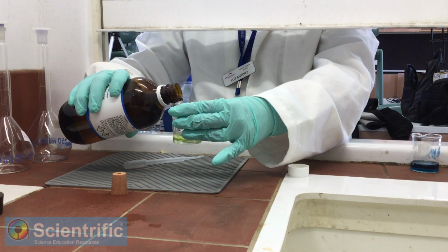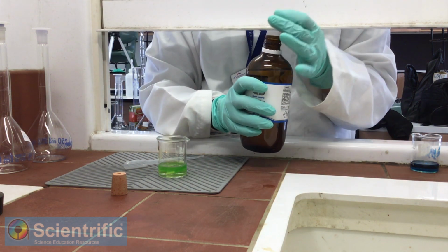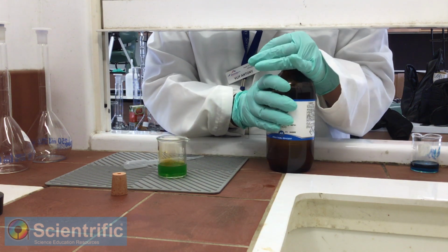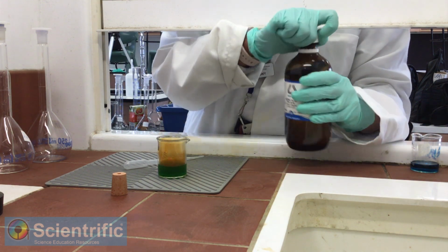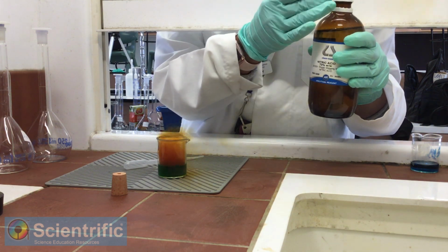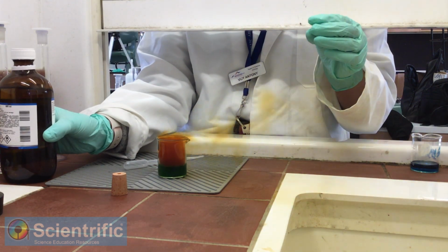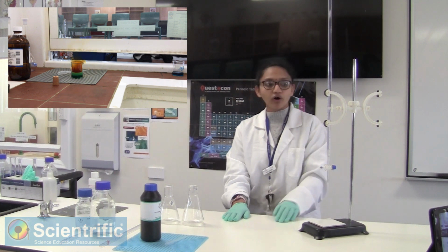As you know, nitric acid is a powerful oxidizing agent. It's very harmful for inhalation and is going to cause severe breathing problems. We added 20 ml of concentrated nitric acid to the brass nails. This was just so that we can get the copper inside the nails into solution. Because if you don't have it in solution, we're not going to be able to determine it. And if you don't determine how much copper ions are there, we can't find out the percentage of copper in brass. So let's move on.